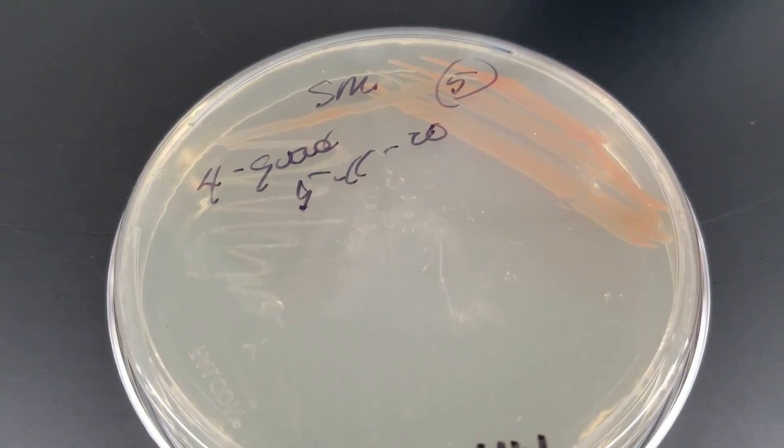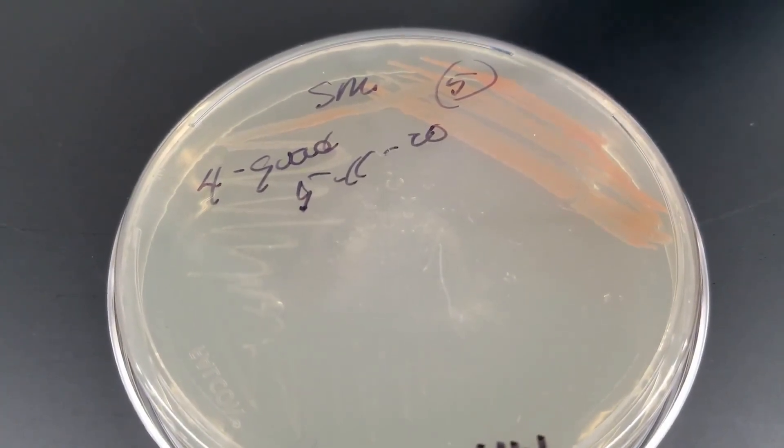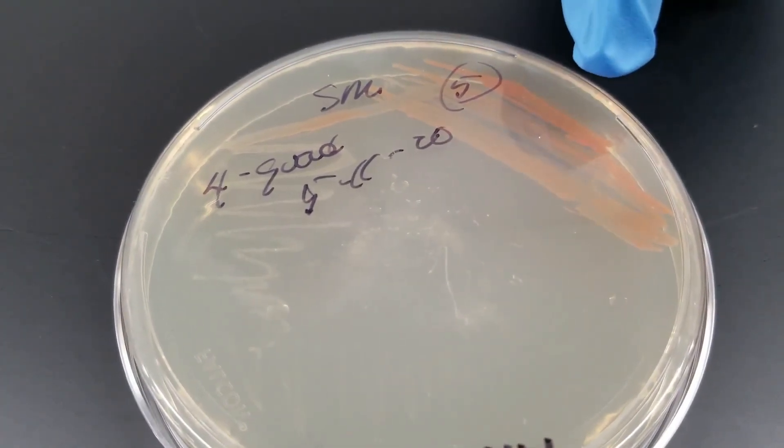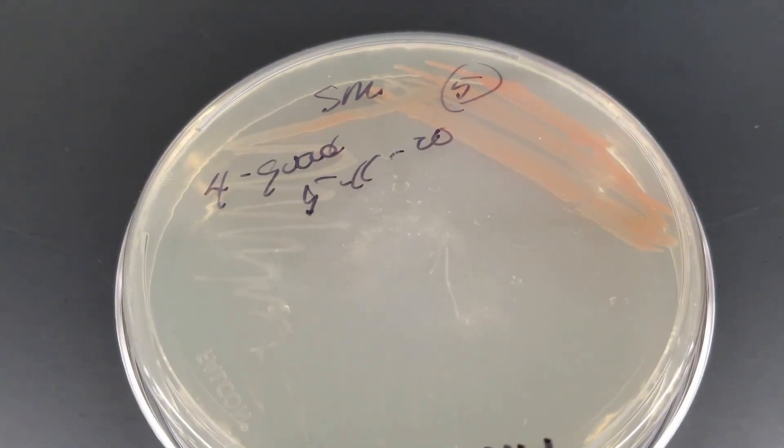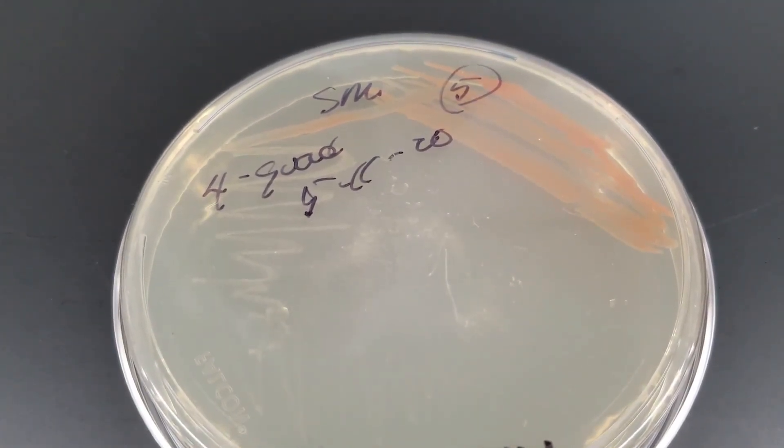So if you were to go culture from this, you don't want to go from where the heavy growth is, because that may still be a mixed culture. Go from an individual colony.